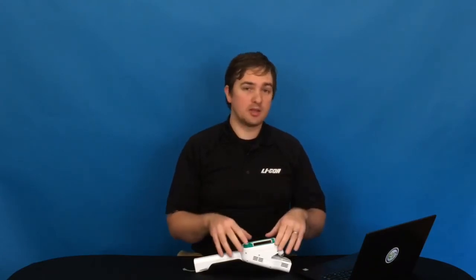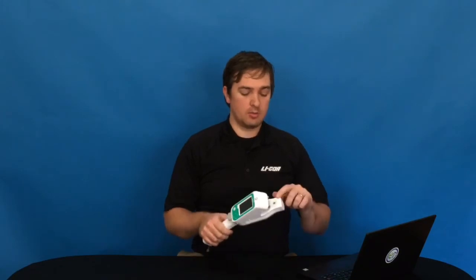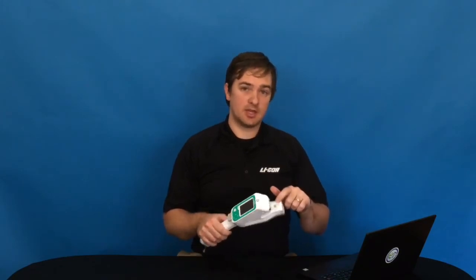So that is how you do a calibration. Once you're finished, make sure that you put the instrument back together completely as it was, including replacing the buffer beads if you've taken those out, replacing the leaf clamp if you've taken that out, and putting the shells back on the sides of the instrument. Now you're ready to go make measurements.